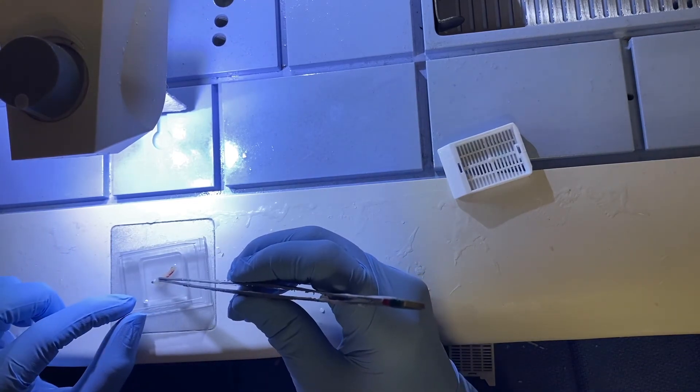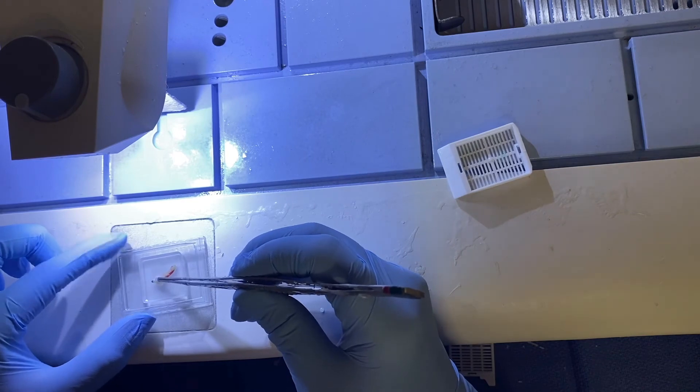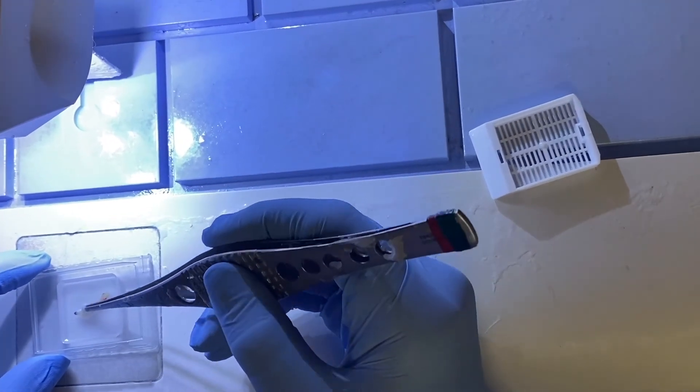All right. So same thing. We're going to push it down so that the entire edge is even along the bottom of our mold.